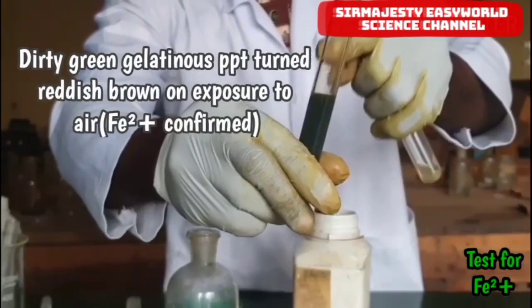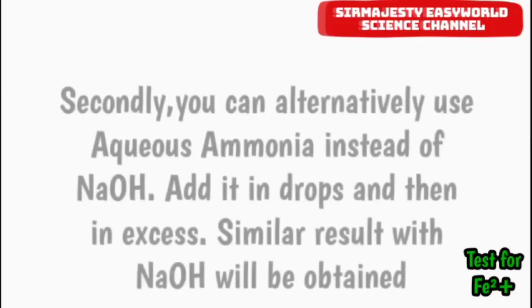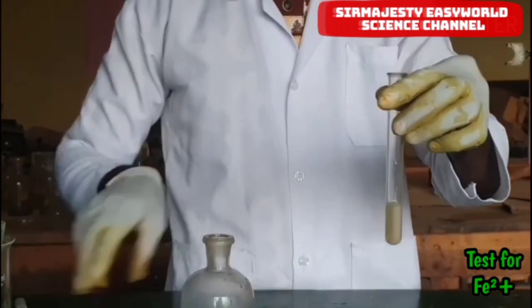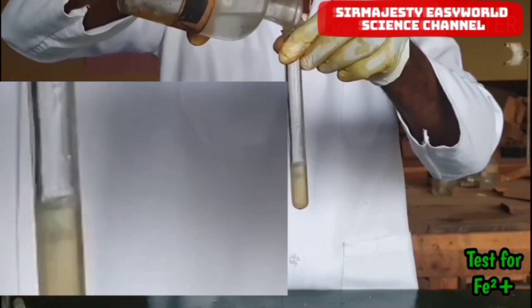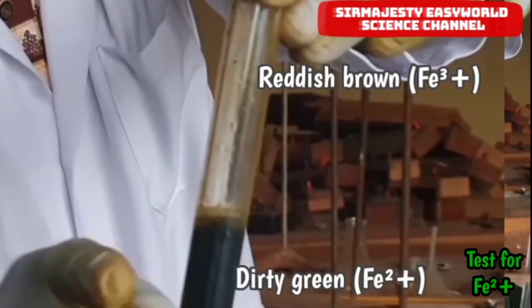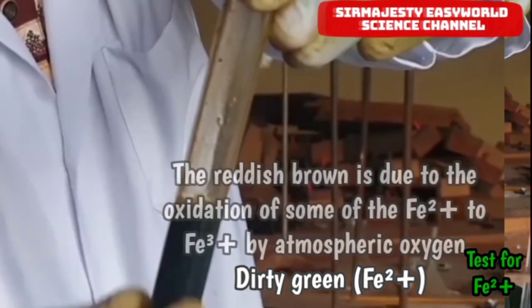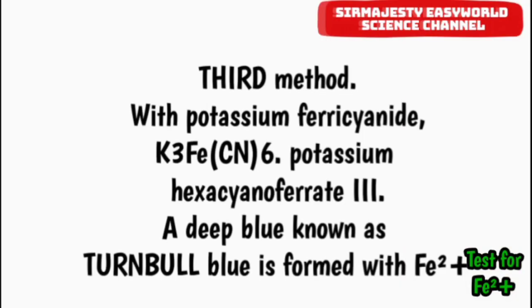Now using aqueous ammonia, we observe similar results — the exact same thing observed with aqueous sodium hydroxide. In drops, a dirty green gelatinous precipitate is formed. On standing, oxidation of iron 2 to iron 3 occurs. The upper part of the test tube is reddish-brown, which is iron 3, and the lower part is iron 2.